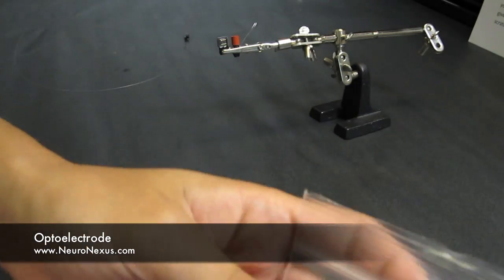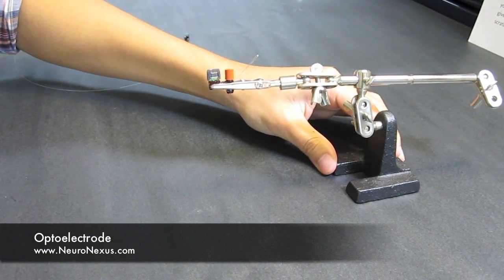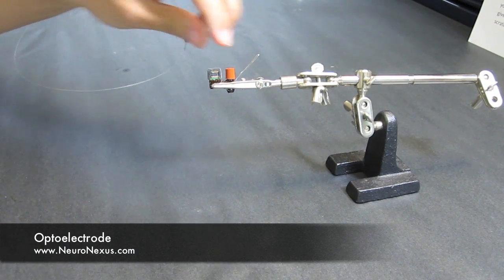So before each use, we recommend you just give the probe side connector a quick wipe with the scratch free cloth.